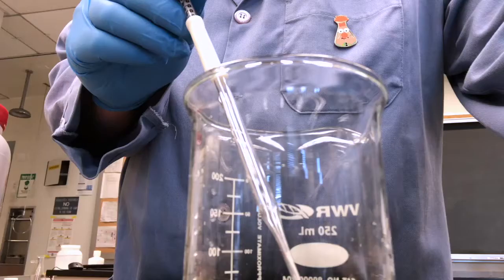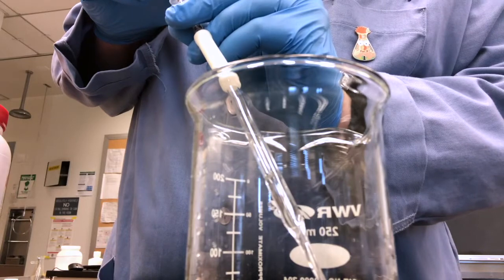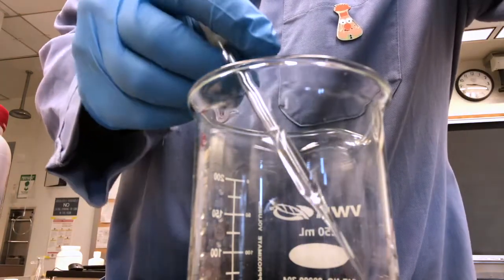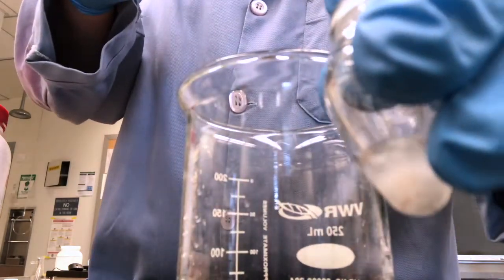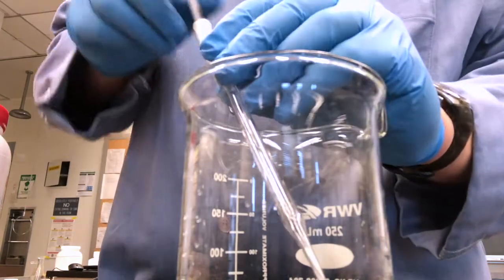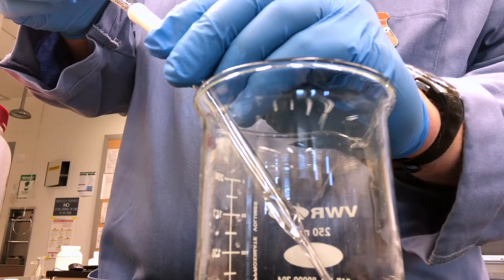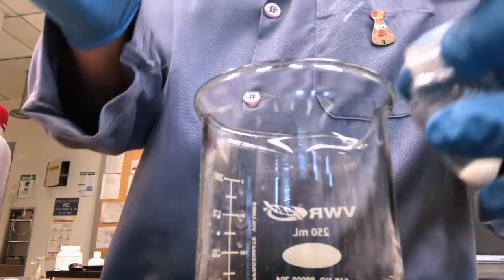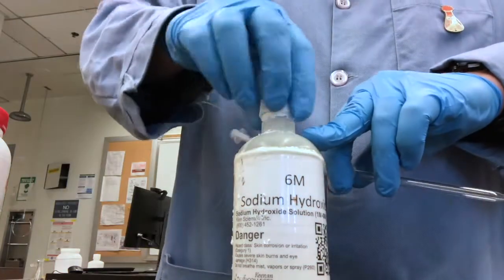First, we'll add our water, 1.6 milliliters. We'll take 0.8 milliliter increments from the syringe pipette using the deionized water. You can see that the solid doesn't completely dissolve initially. There's the second 0.8 milliliter portion. Once this portion of water has been added, we can add the sodium hydroxide.